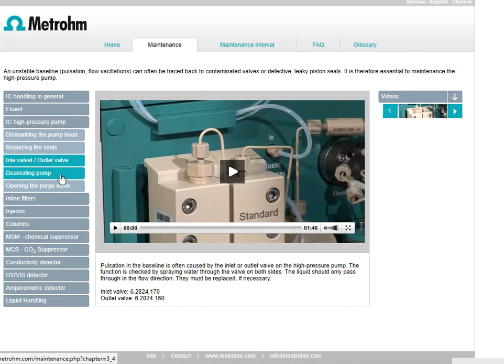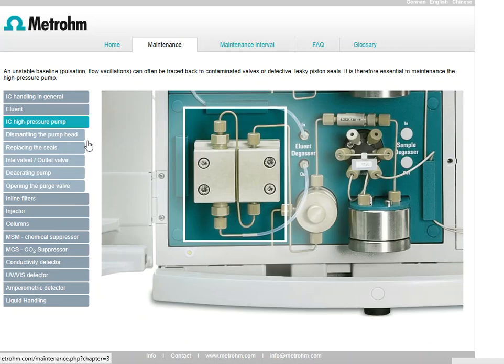The next one's de-aerating the pump. Now that I've taken all of this off and replaced the seals on the inside where the pistons are, and I've cleaned everything with methanol and isopropyl alcohol, and then took the inlet and outlet valves off and cleaned those to make sure they were working the proper way, I'm going to have to put everything back together, right? And I've just incorporated air into the system by doing that. I've unscrewed this piece on the high pressure pump, and this piece, and that piece. Now air is going to get trapped in the line. There's no way around it.